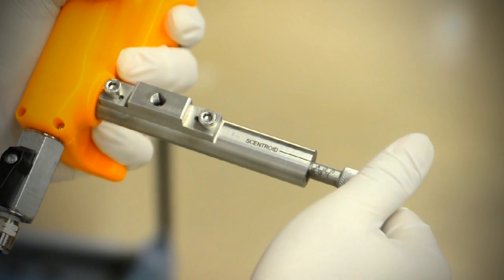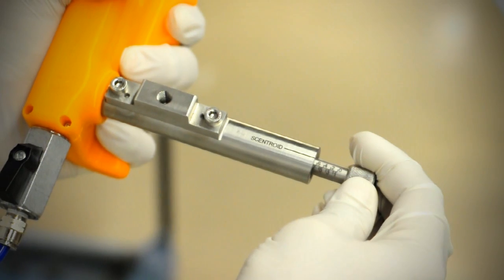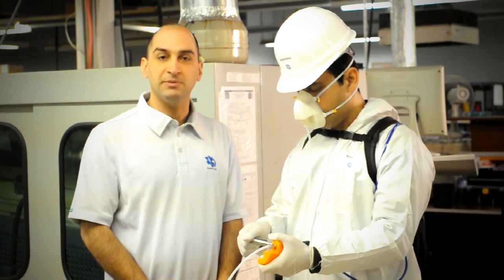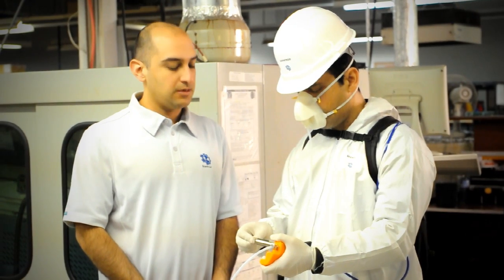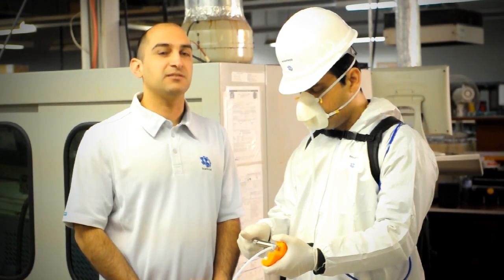Now what he's going to do is take three little steps and this is just to really detect the faint odor of resin. It's not going to be an overwhelming smell because it's being diluted with fresh air. So he slowly opens it and stops when he can smell this faint odor of resin.